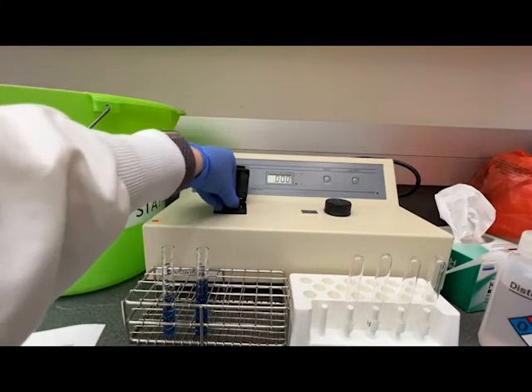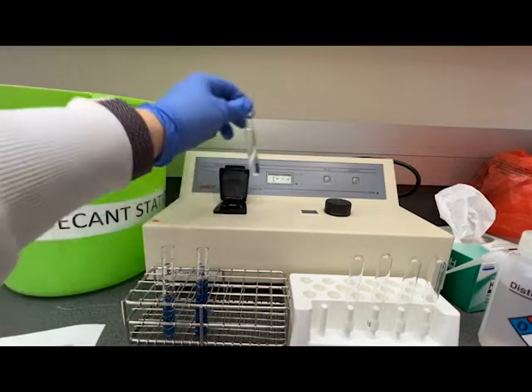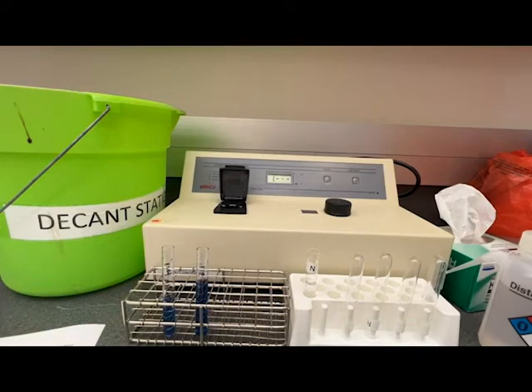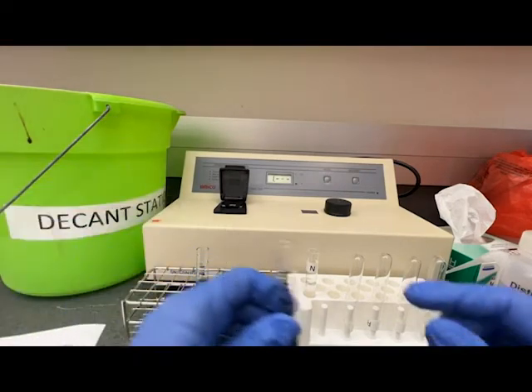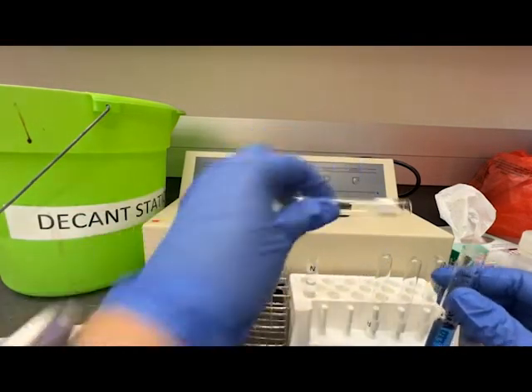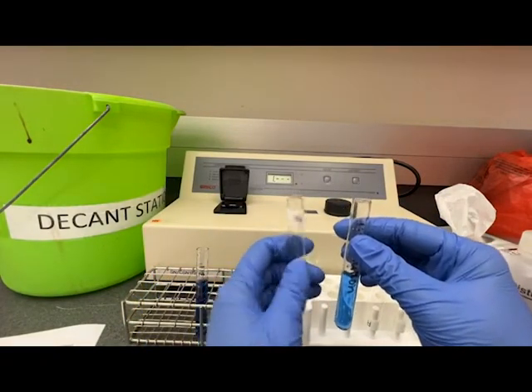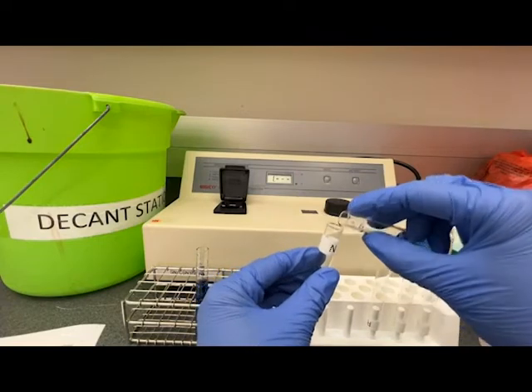Now that the instrument is blanked I can remove this cuvette and I'll leave this over to the side in case we need it again. Now we can transfer the contents of one of our samples to be measured into a cuvette. Pouring is sufficient.